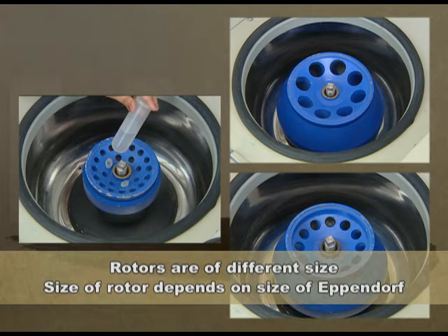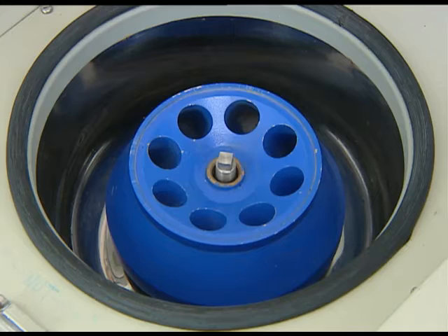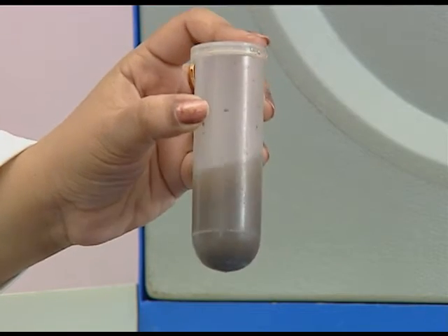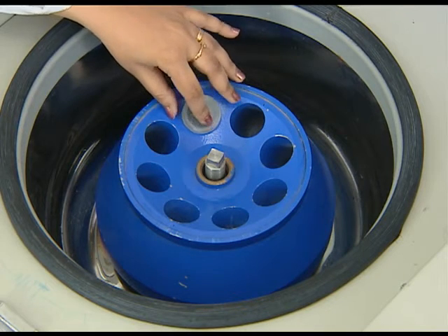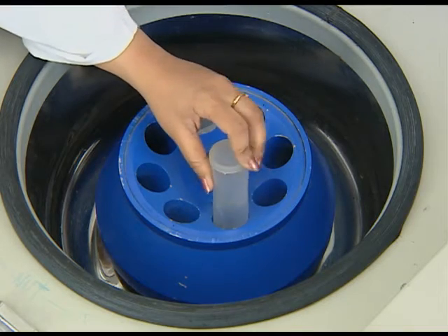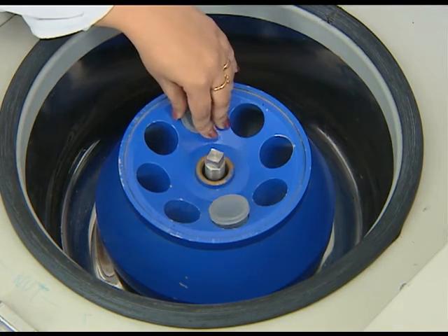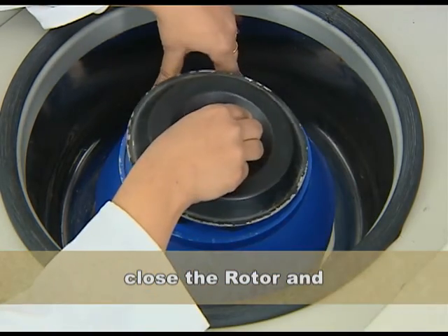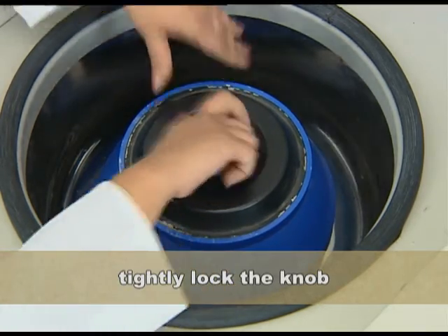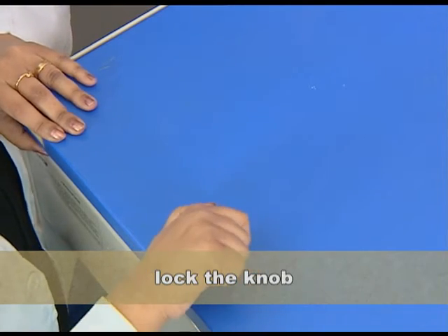Now let me show you the process of centrifugation. Into one centrifuge tube, I have put a little dirt and mixed it thoroughly with water. The second centrifuge tube contains exactly equal amount of water — it is not the sample but is placed opposite for balance. So the position and density are more or less the same. Let me close the rotor and close the centrifuge. I have locked it.